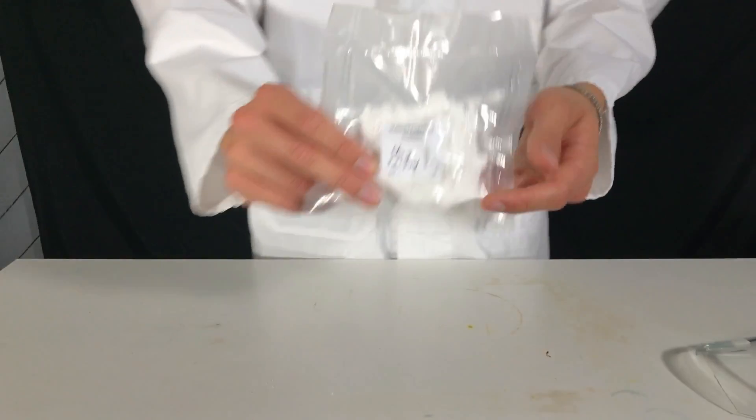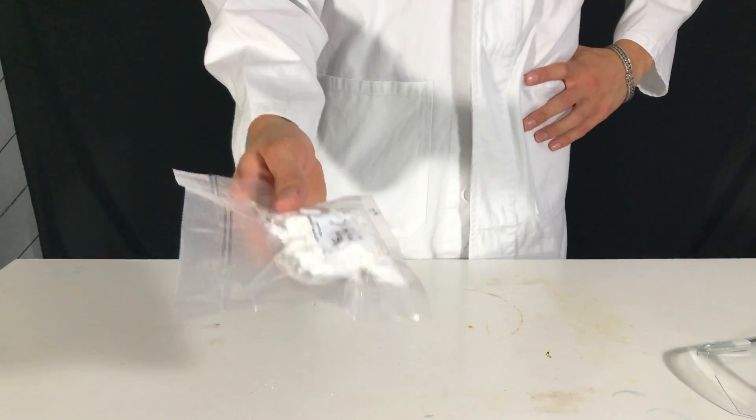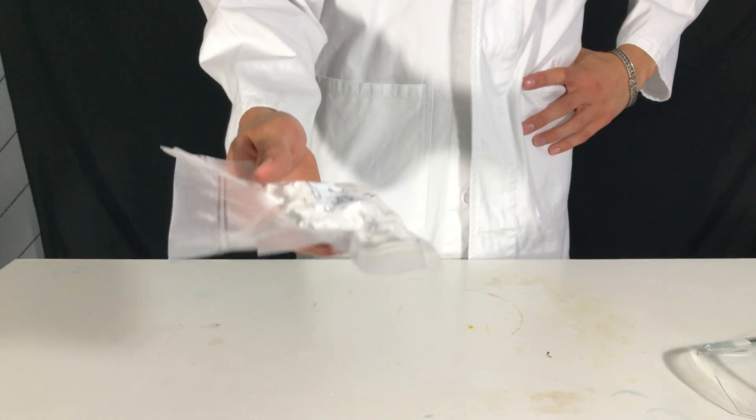In the end, we were left with 66 grams of anhydrous sodium formate. This corresponds to a 97% yield.